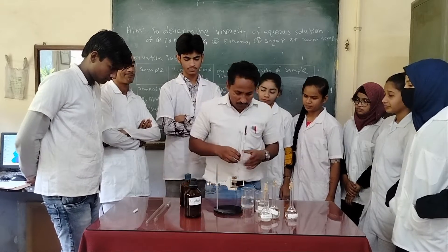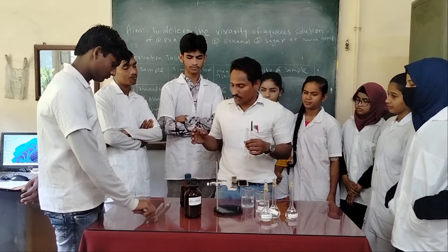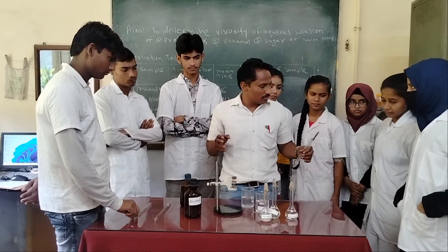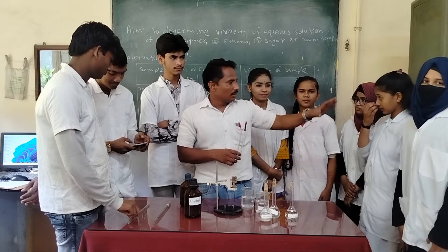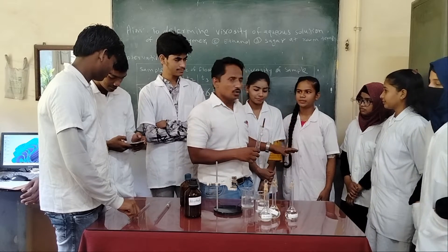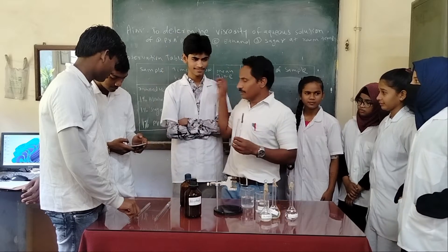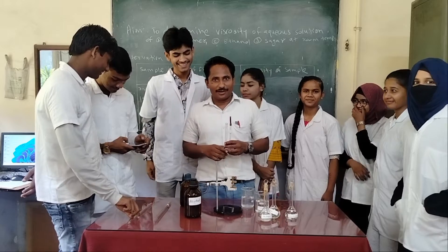So we are going to fill a definite amount of liquid in the lower bulge. First, I am going to show you how to measure the time of flow of water. Let's take a stopwatch — stopwatch over to Iram. This is Iram, this is Drupthi, Fatima, Sumat and Kusum. And this is a young scientist.